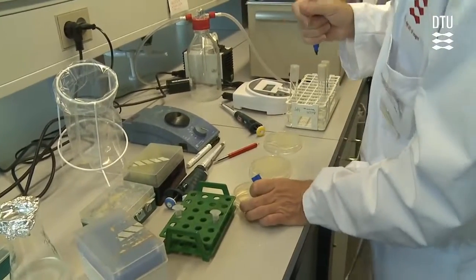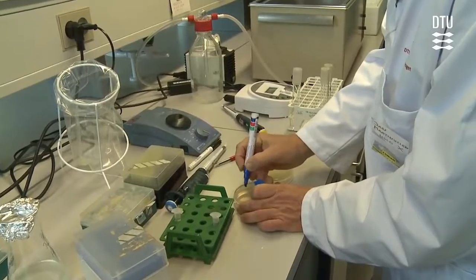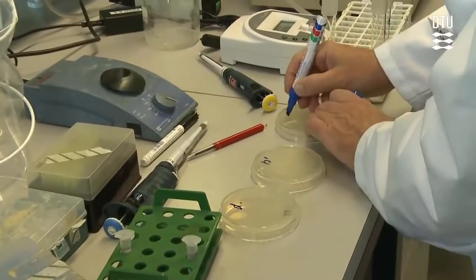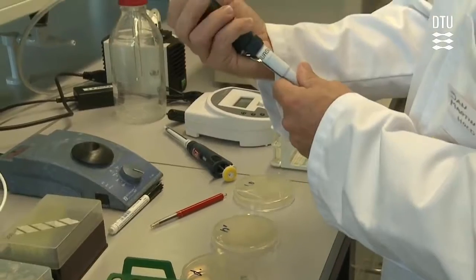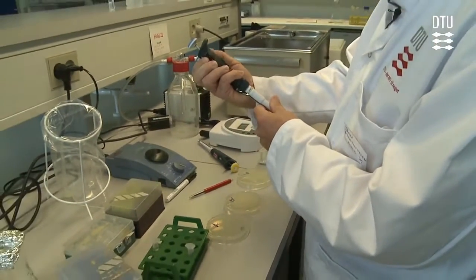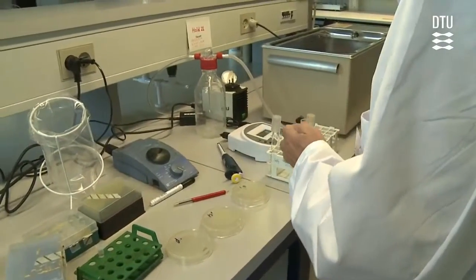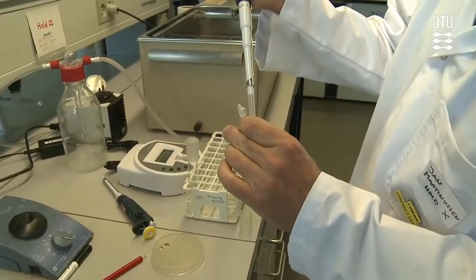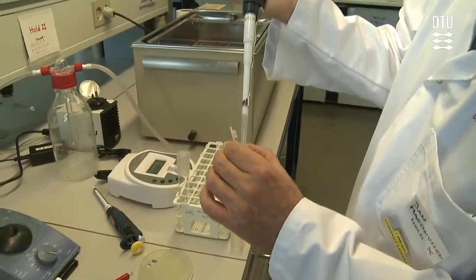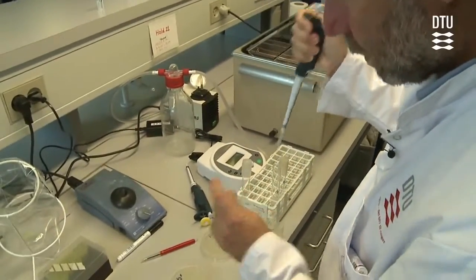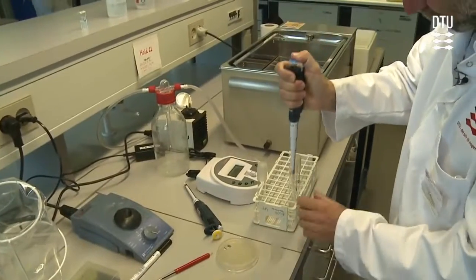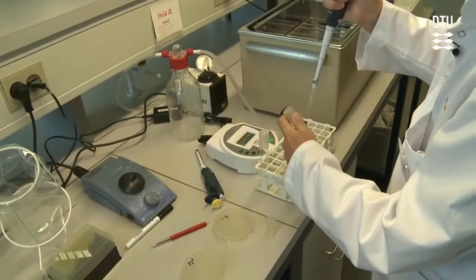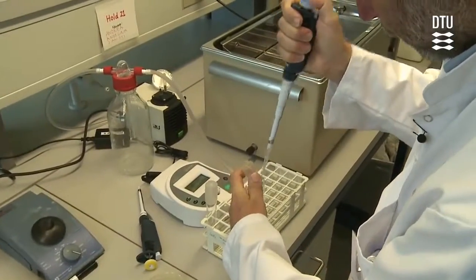Then it is time to plate. What you do for plating: you take a direct plating, and you do a 10-fold dilution and a 100-fold dilution. We take a pipette and transfer 1.1 milliliters from our cells into sodium chloride, as you have been doing before. So it's a 10-fold dilution and a 100-fold dilution by taking 1.1 milliliters from the previous tube to a 10 milliliters sodium chloride.